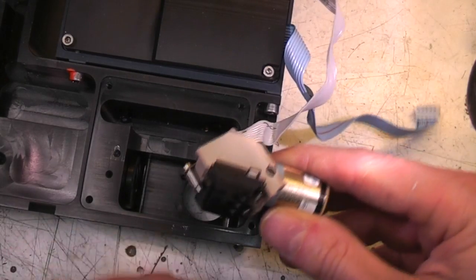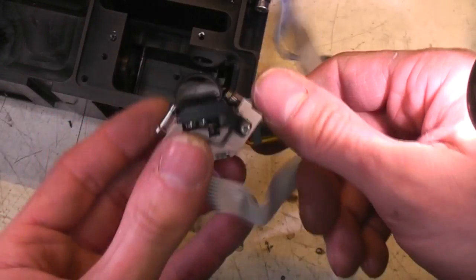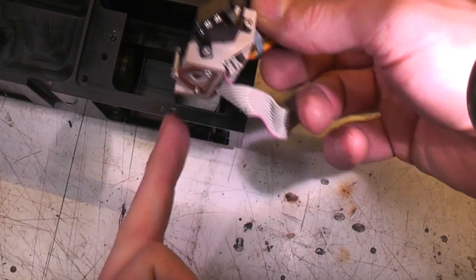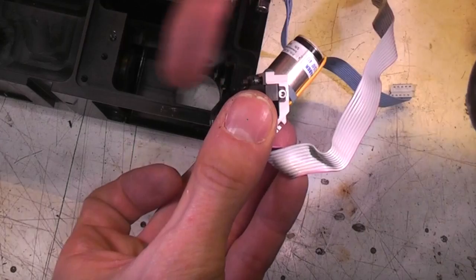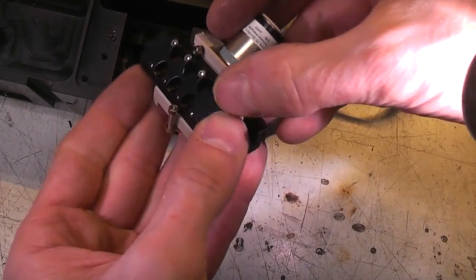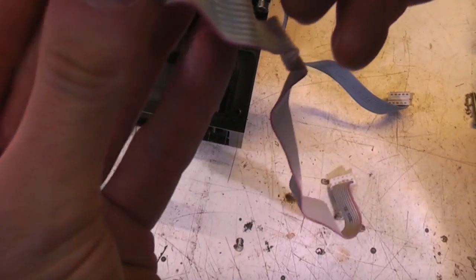Oh, actually yes, because this is where that external beam port was. That could go straight through to allow the beam to go straight through that way, or it could reflect it that way, or it could do a partial reflection, so some went that way and some went this way. So that's just a 3-way selector.